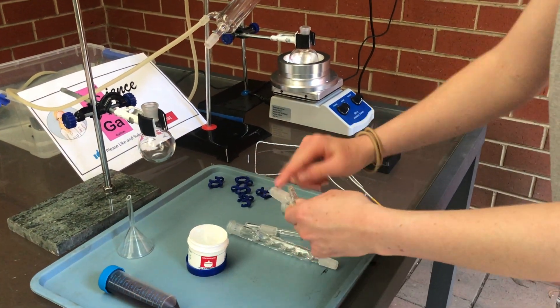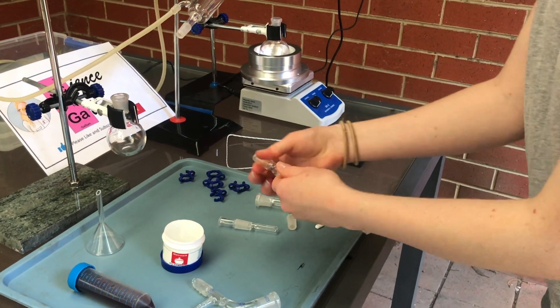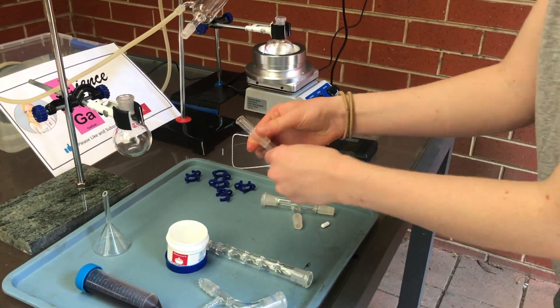Before I start purifying the acetone, I start by greasing all the connections and then I drop the stirrer and then pour the acetone into the round bottom flask and then assemble the set.